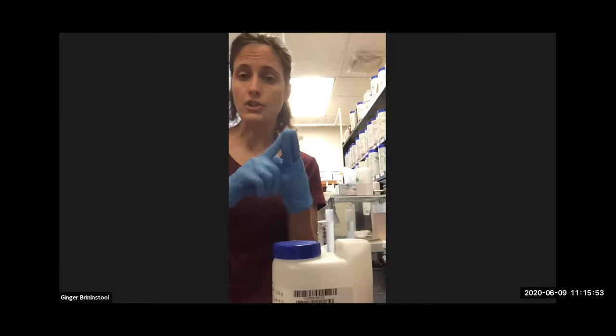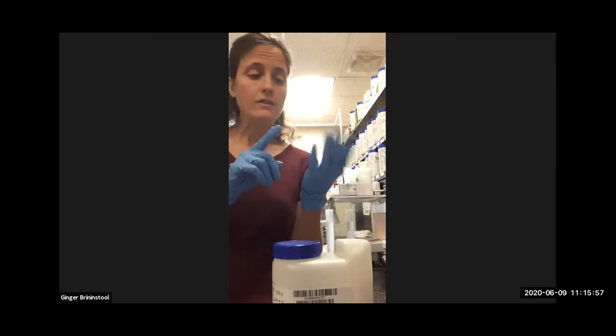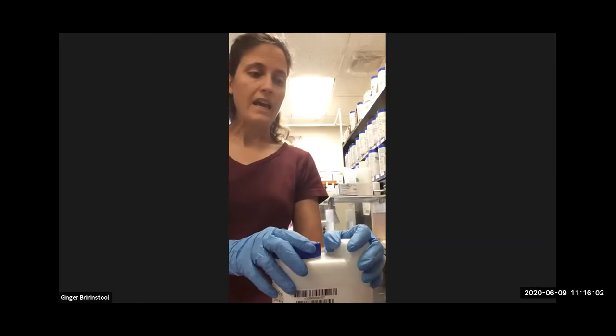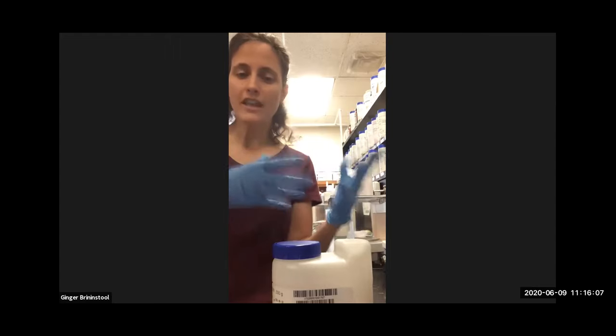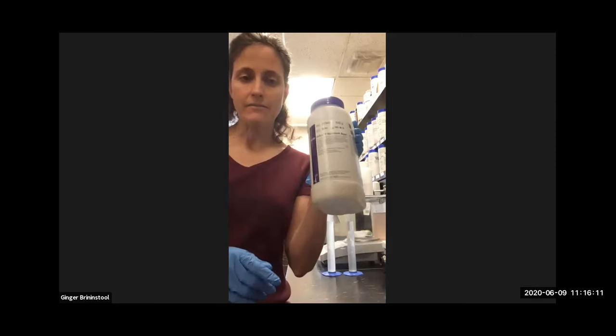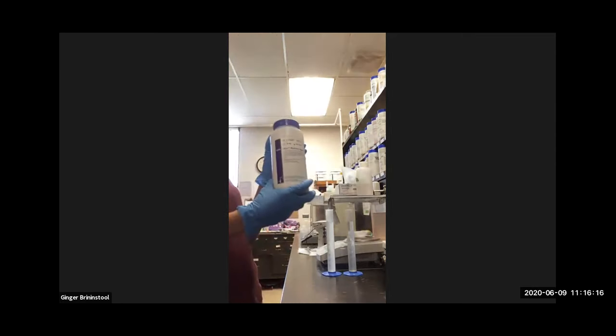And so a cake from scratch has flour, sugar, a little bit of salt, baking powder. Those are the dry ingredients, right? And in the box cake that you buy, that's in a little bag, all together, all mixed up, right? This is like a box cake. We can go up here and we could probably, yeah, I'll show you. We could go and we could make nutrient agar.